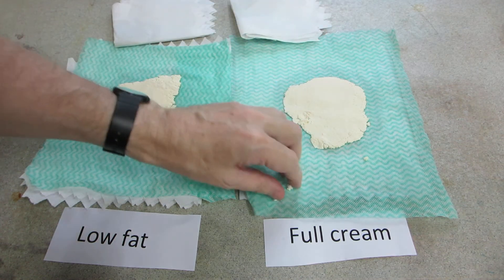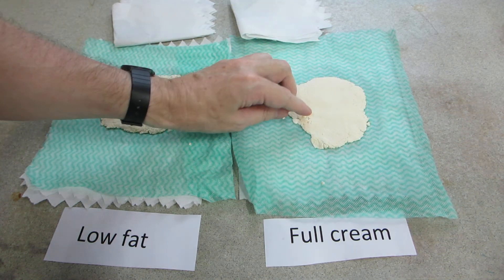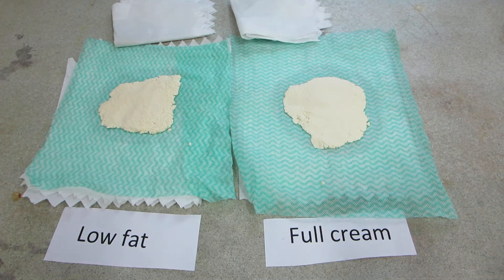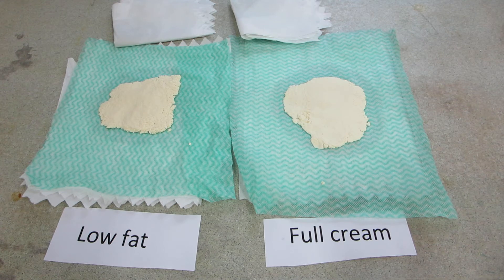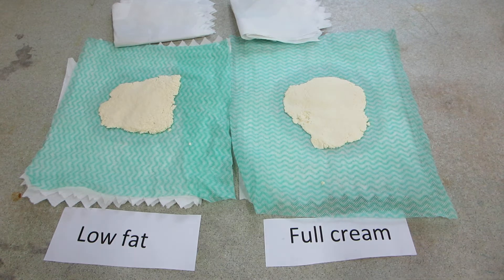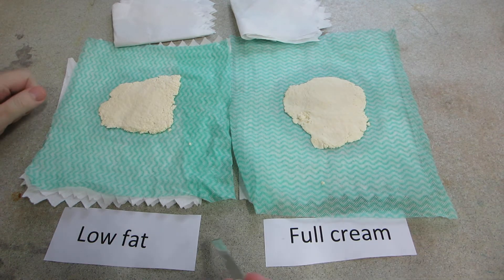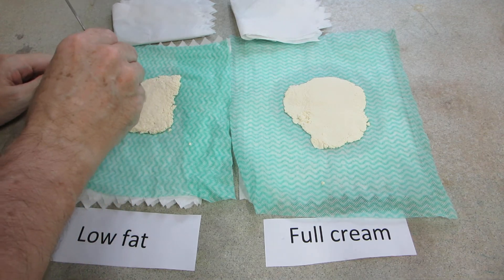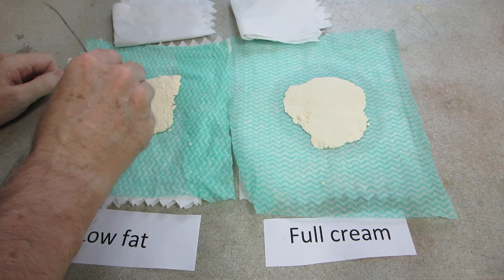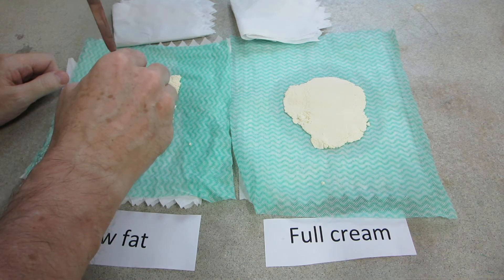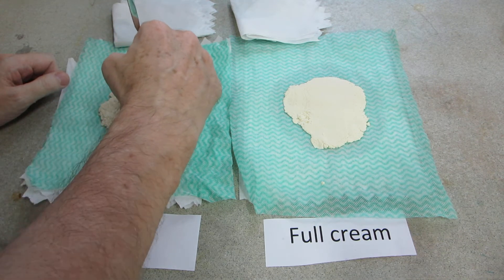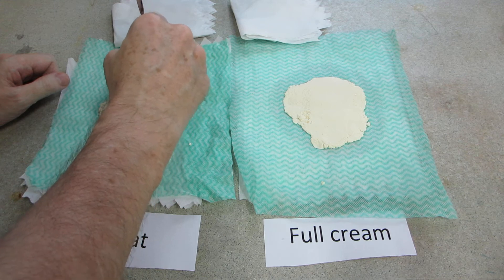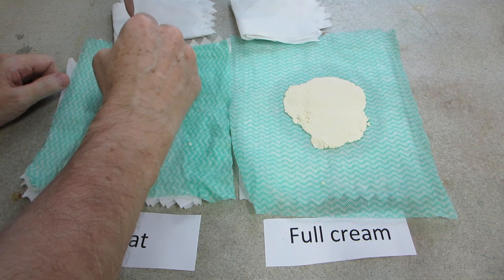I've just broken some off there, look. Well, let's cut a crude shape before drying. I'm not sure I've really compacted it enough, but I'll have a go.